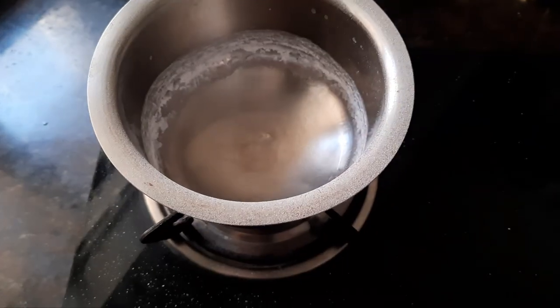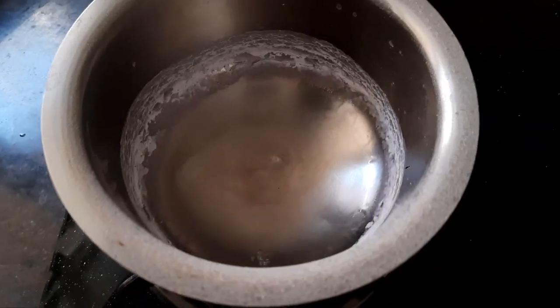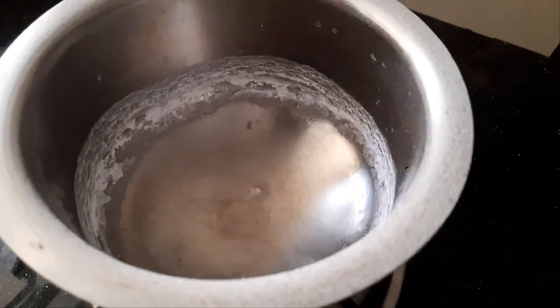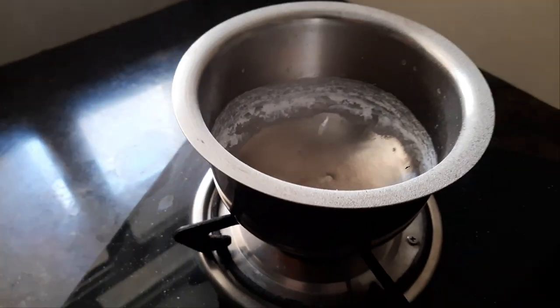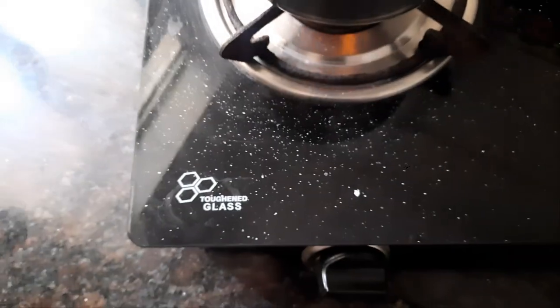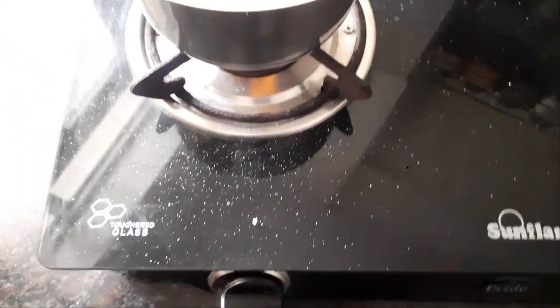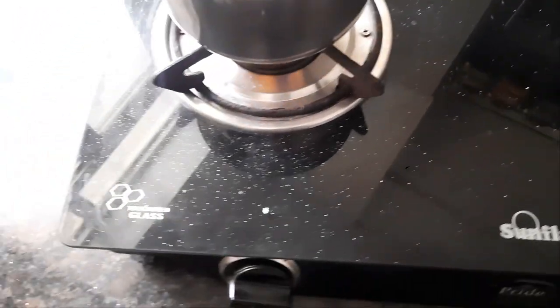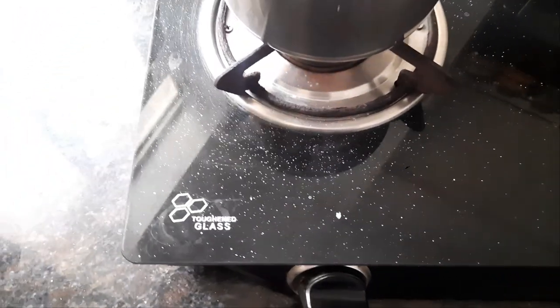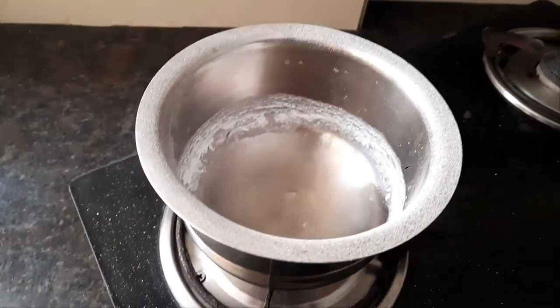Most of the water has been boiled. See the salt that has been deposited on the sides of the container and also what you see around the container — this is also salt. So the salt that you dissolved is the same salt that you see outside and deposited around the container.